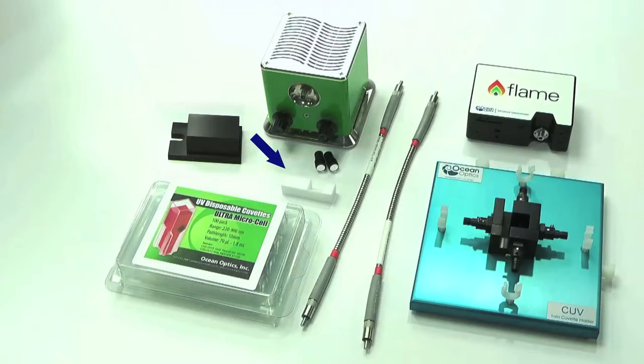A diffuse reflectance standard for use as a reference when taking fluorescent measurements, and finally two mirrored screw plugs that can be attached to the cuvette holder to maximize the amount of fluorescent signal reaching your spectrometer.